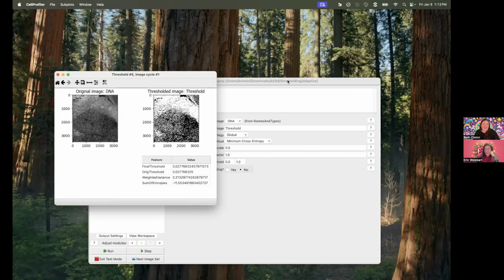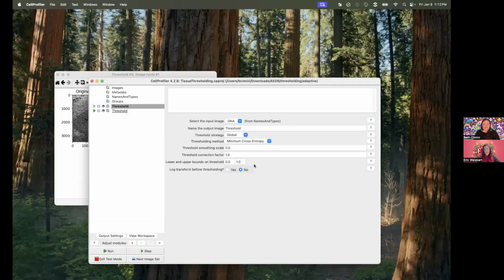This is actually going to kick off a few of the next several episodes about the thresholding settings in CellProfiler and why it's really important to understand all of them, even though there's a bunch of them, because you can solve a lot of problems just with changes in how you do thresholding. And the key setting here for Susan is this threshold strategy.